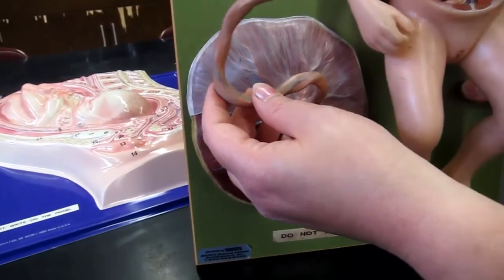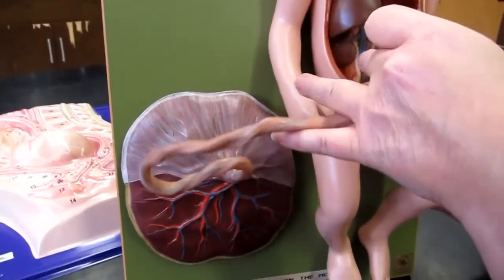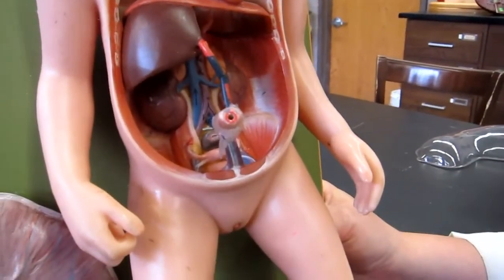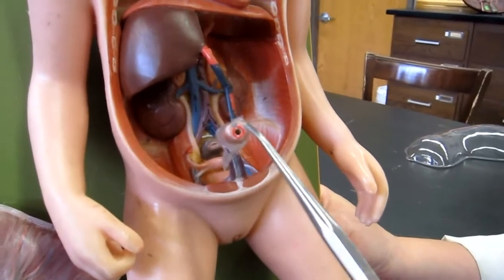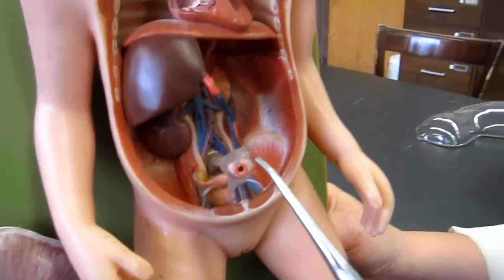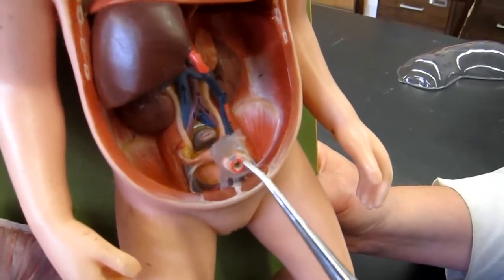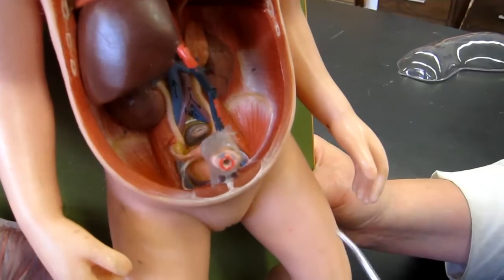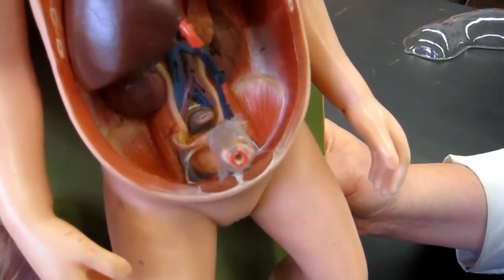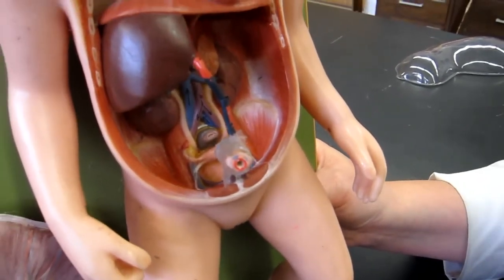Here's the umbilical cord. And if we open this up, you can see in the cut surface here, it kind of looks like two eyes and a little mouth. It reminds me, I'm going to date myself a little bit, of Mr. Bill, the old guy that used to be on Saturday Night Live saying, "Oh no." Okay, but that red right there that looks like Mr. Bill's mouth, that is the umbilical vein, and the two blue ones are the umbilical arteries.